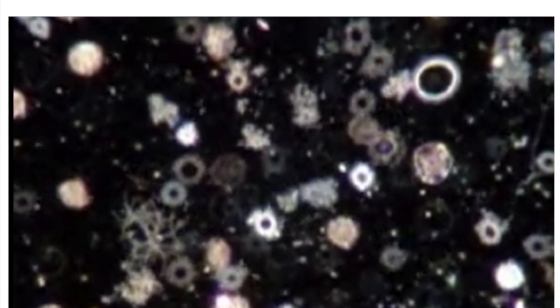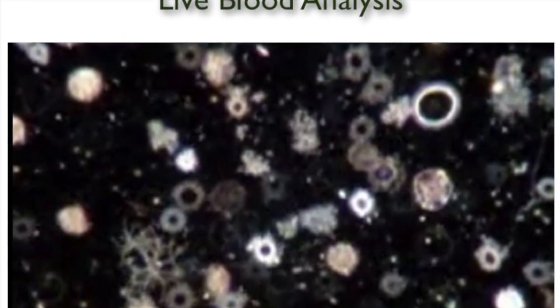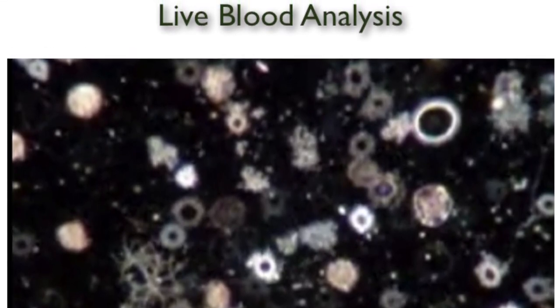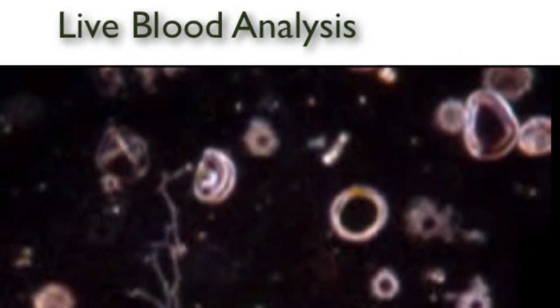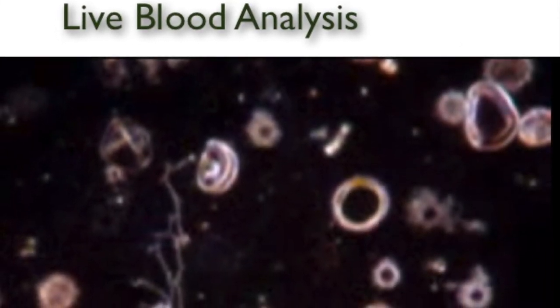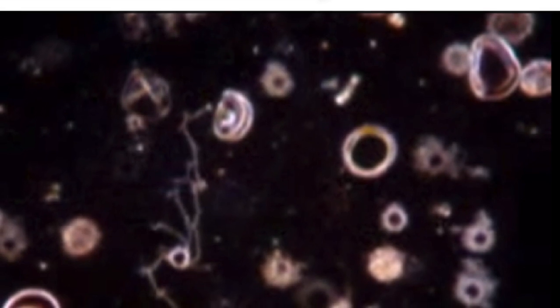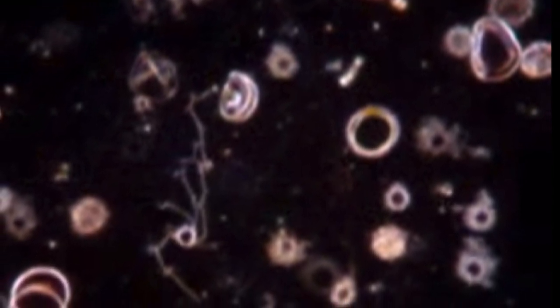For the purposes of this program, live cell analysis is useful only in the identification of blood cell morphology and the time in which the blood sample decays. The advantage of the live cell analysis allows for the visualization of the granules within the leukocytes and their movement throughout the sample, indicating the health of the immune system.